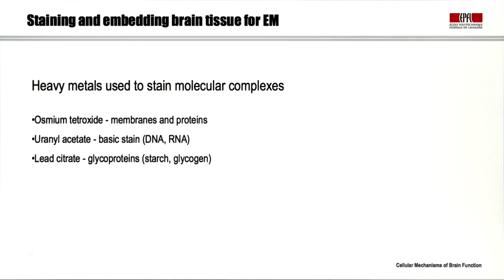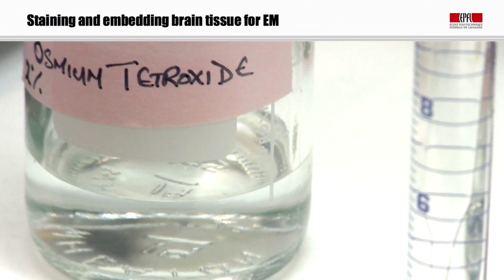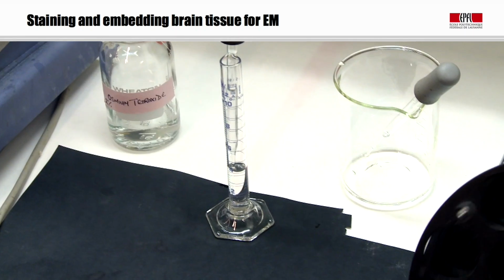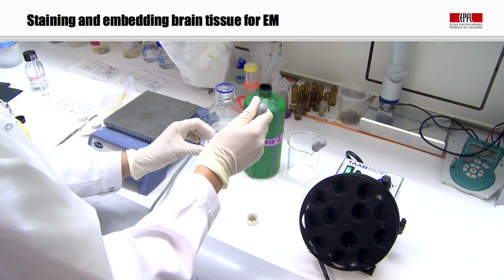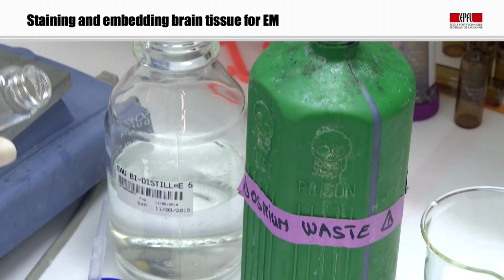And we also use compounds like lead citrate, which will stain very heavily glycoproteins like starch and glycogen. So again, these are very toxic compounds, and we need to work in a fume hood. And the first process is typically to introduce osmium tetroxide. Then we have a rinse of uranyl acetate, and then we may use some lead staining, but often the lead staining is done afterwards.